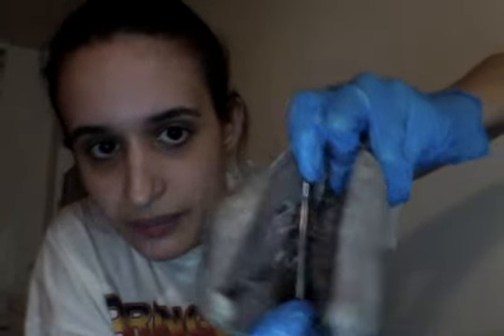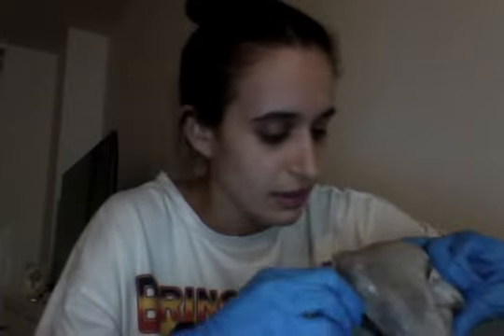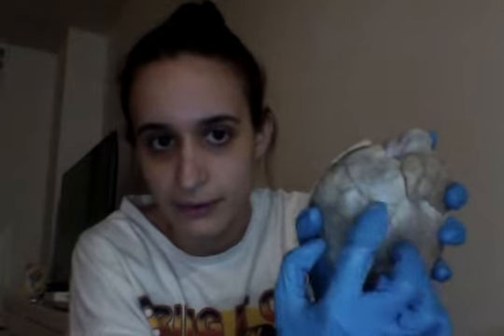And then we have the chordae tendineae, which was really cool to see. You can see it where my dissection tool goes through. That's the chordae tendineae. They're really cool. I thought that was probably the coolest part to me. And then the coronary arteries, which you can see kind of running through here, and helps supply more blood within the heart.